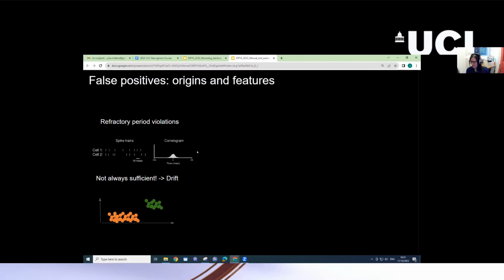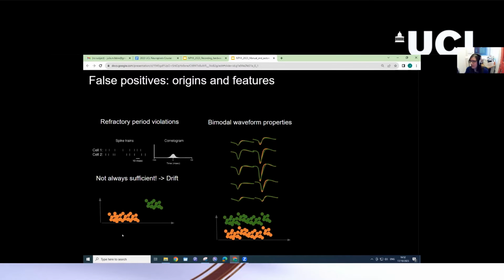Now, this is not always sufficient. So I tried to illustrate this with this cartoon. There are certain scenarios where looking at refractory period violations is not very helpful. And this is particularly true if you have spikes from neurons that have been merged together in the same units, but these spikes do not occur at the same time. So here on the x-axis, we are representing time, and here we are representing some feature of spikes. And these are the spikes from one neuron, and these are the spikes from another neuron that are mistakenly lumped together in the same unit. Since they occur at different times in the recording, we can't really have any refractory period violations between these two different types of spikes. There are still other things we can look at to evaluate whether there are false positives.